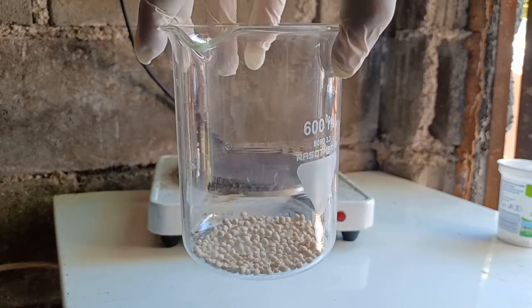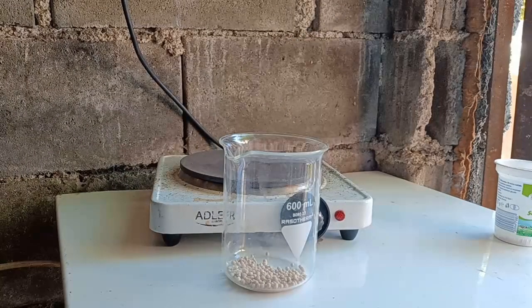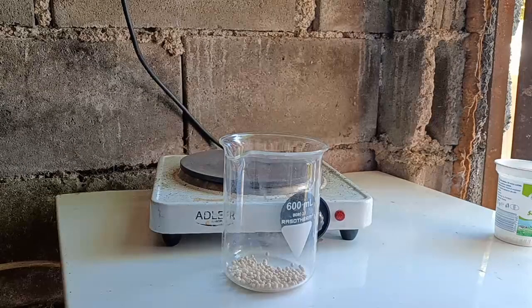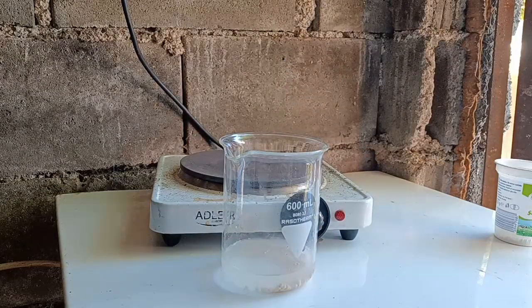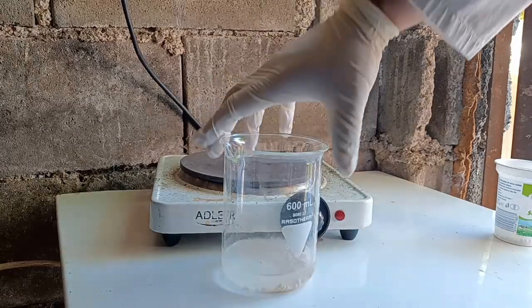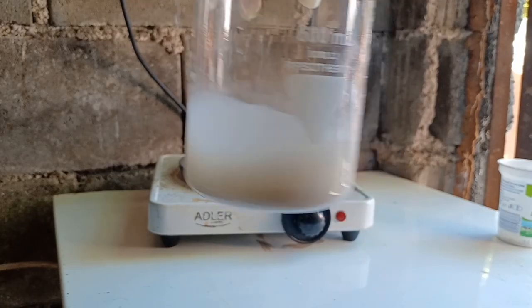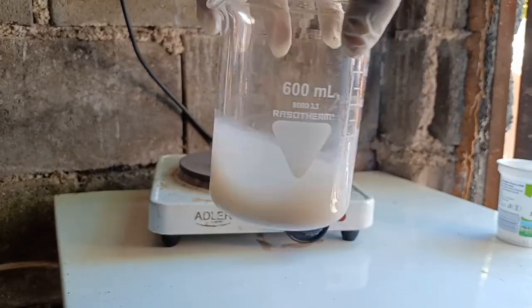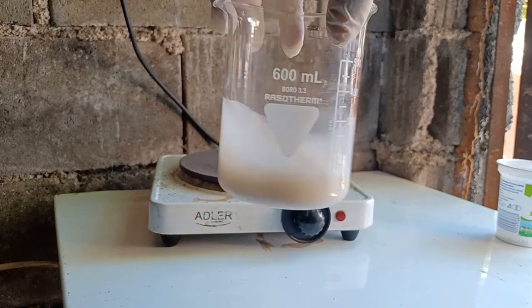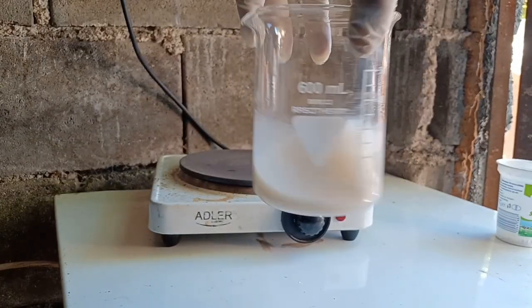To do this, I first dissolved 12.5 grams of the fertilizer in 100 milliliters of distilled water. Then I added 4.6 grams of lime. That is, for all intents and purposes, basically technical grade calcium hydroxide. This reaction makes calcium nitrate and ammonia gas. This is when the gas mask comes in handy.